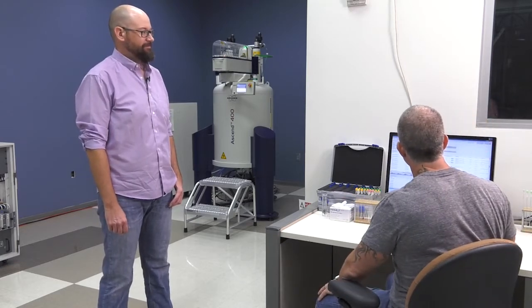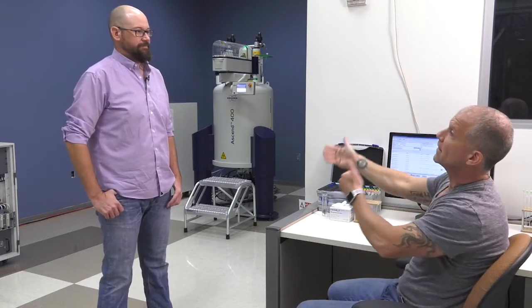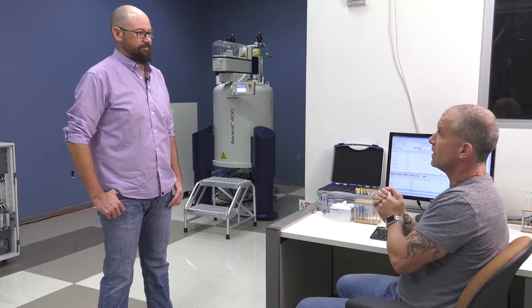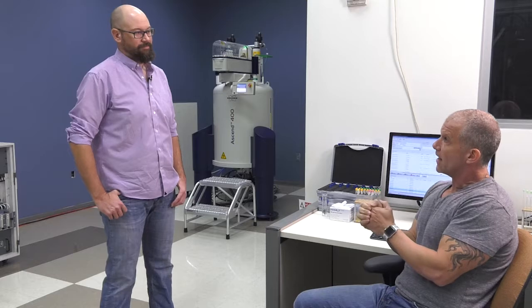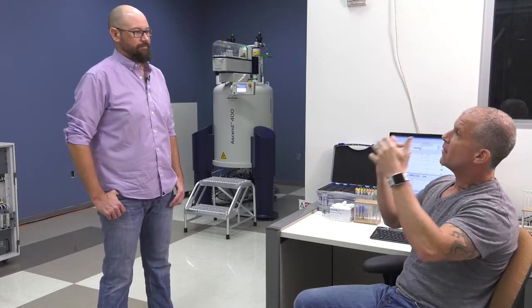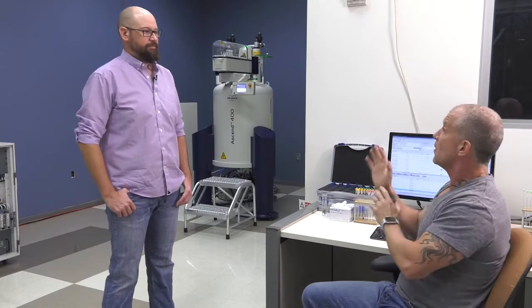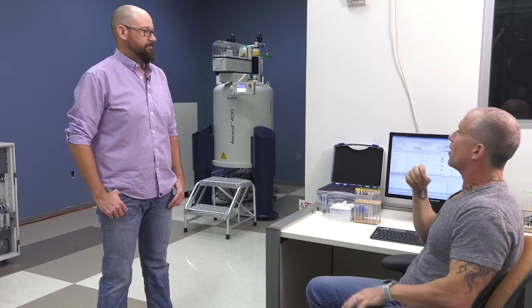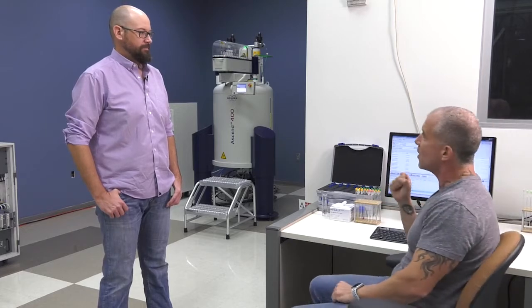Then the other thing that's unique to your facility is we have a cloud-based service where all of this is stored remotely called Spinchem. And so it asks for your Spinchem username. And so this is something you already have to have, registered and available. So if samples are sent remotely, they would need to have been registered. Correct. If these are samples for a class, they would need to have a class name of some sort. And then finally, there's a comment box where you can add stuff like that. So I've entered all this information for the sample I want to run today.